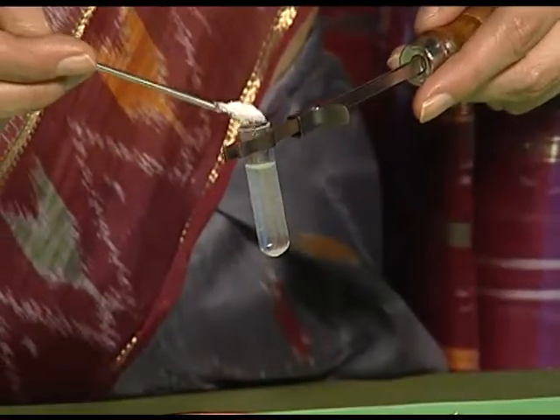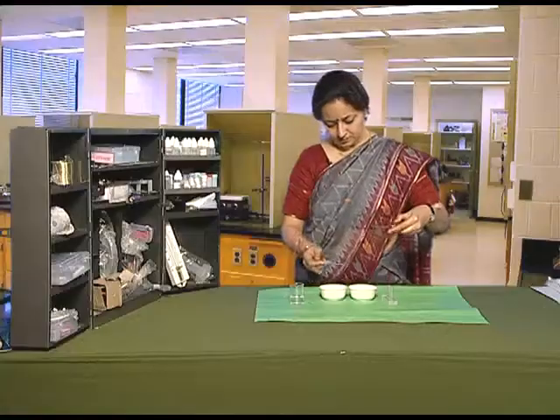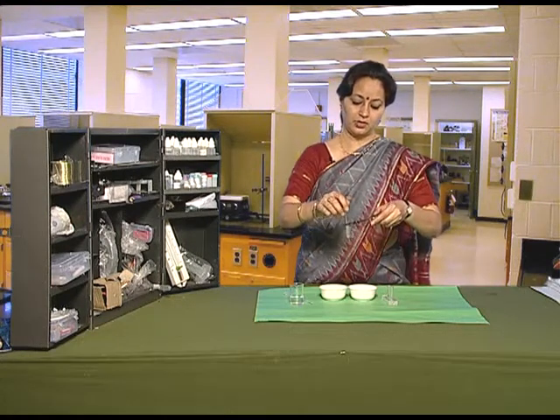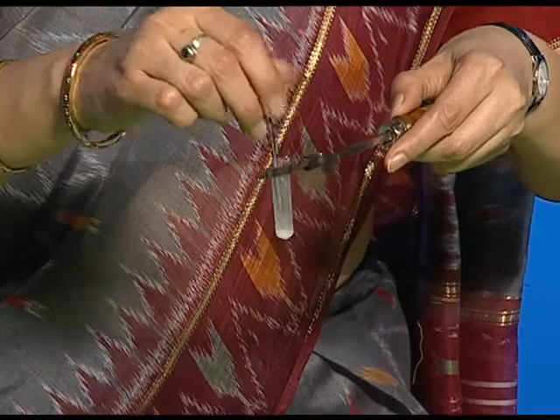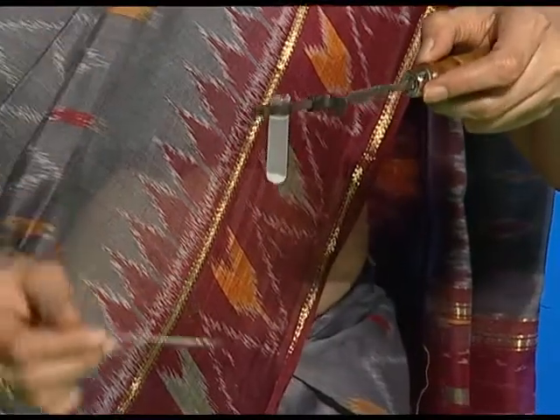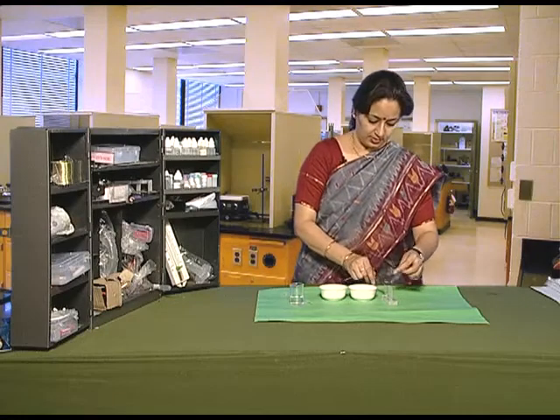We'll add more amount of salt. If we further add some more quantity of salt, it will not get dissolved — instead it will start settling down. It means that it has now formed a saturated solution with these three spatulas of salt. Keep it back.